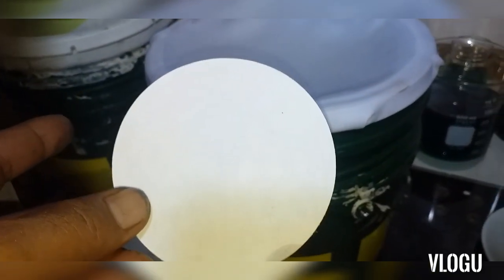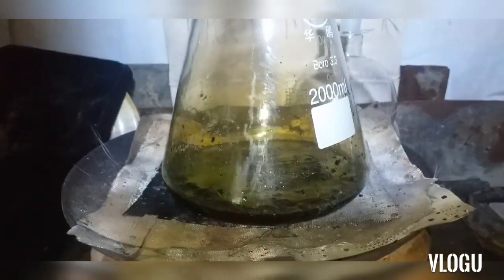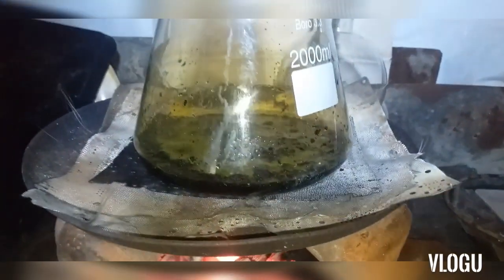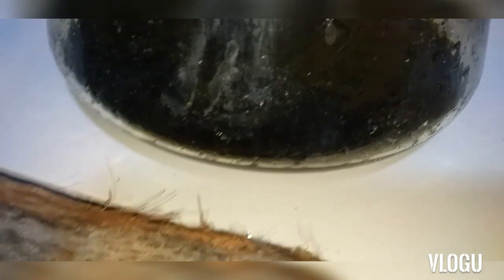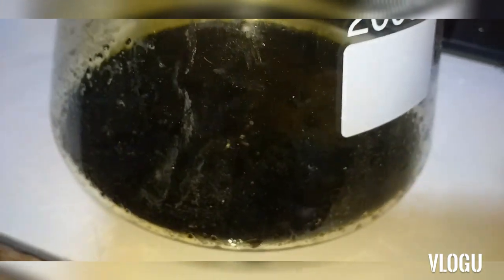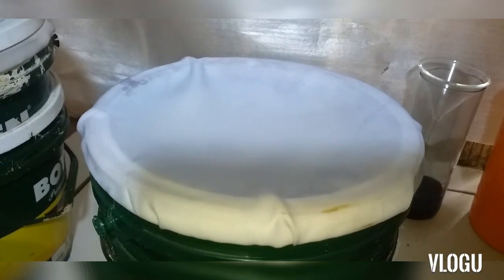Then precipitate — this will be allowed to settle within 12 hours. The reaction is almost complete, so we're allowing the solution to cool down, then filter. In just 30 minutes all of the gold-plated wire and connectors are dissolved from the aqua regia. We're allowing the solution to cool down, then we proceed to filtration to remove solids and any plastics.